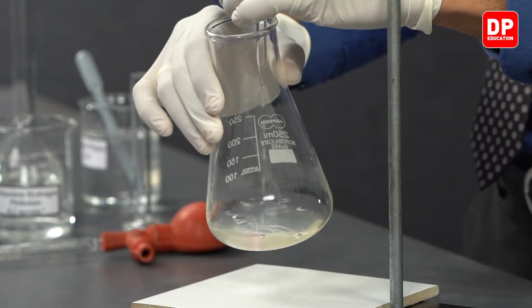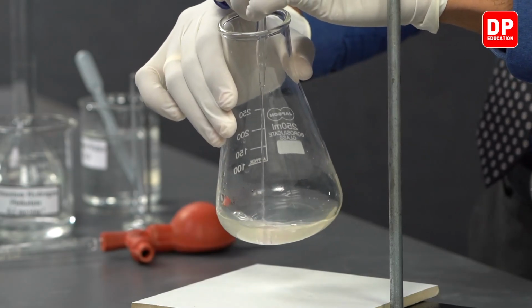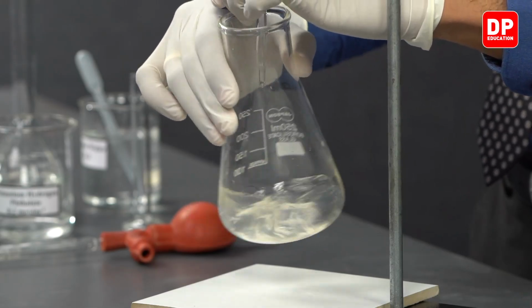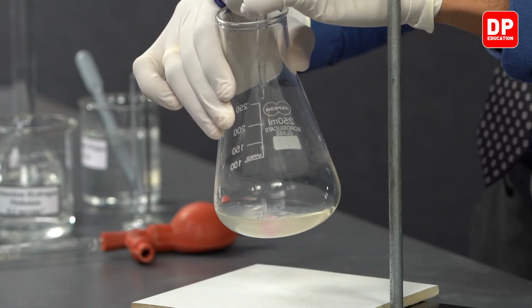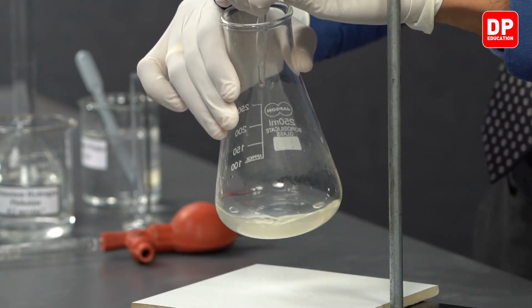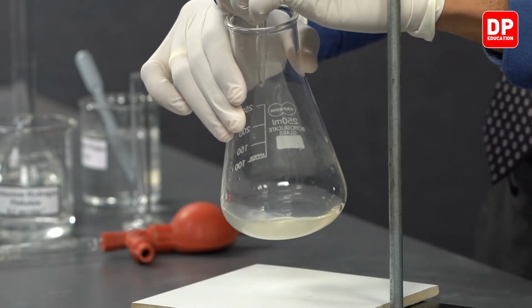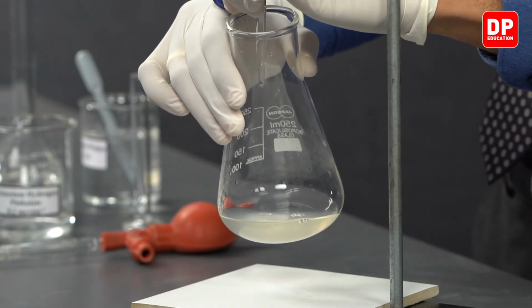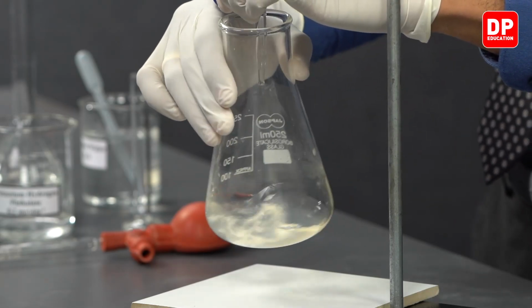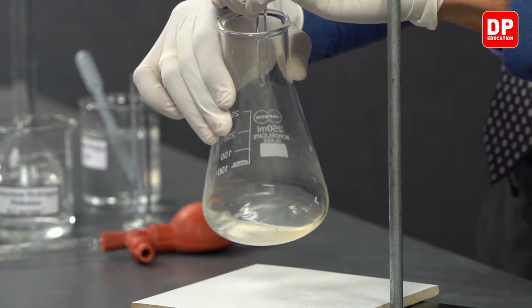Let's carefully add sodium hydroxide to this solution to obtain our endpoint. You can see as soon as sodium hydroxide is added, there is going to be a pink color, but immediately this pink color will disappear due to the medium being quite acidic. That indicates that we still have enough and more acid in the medium.